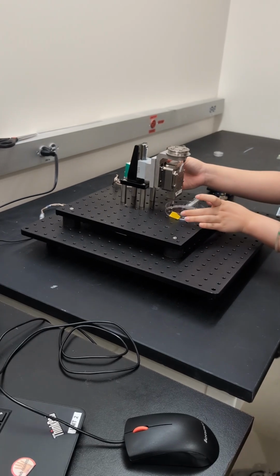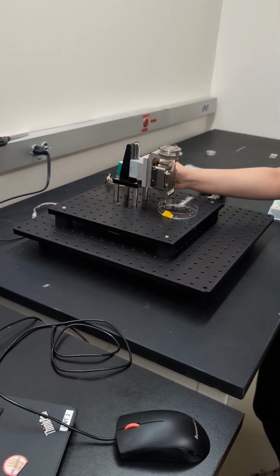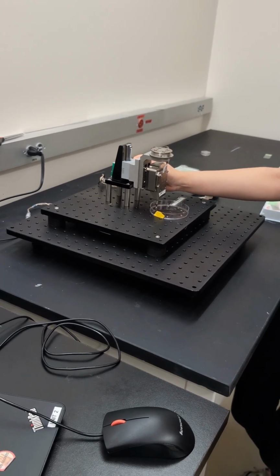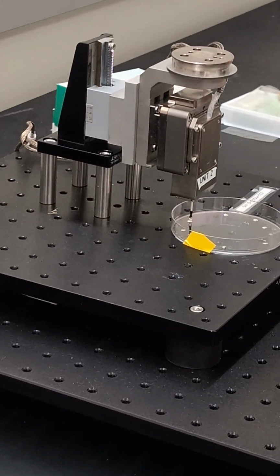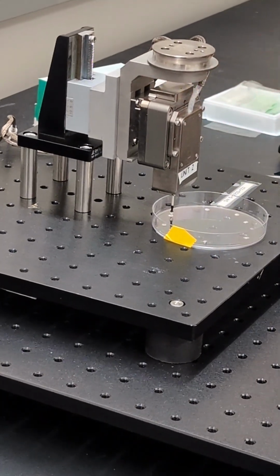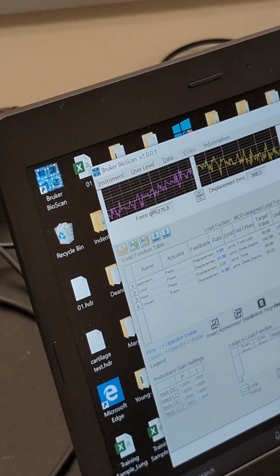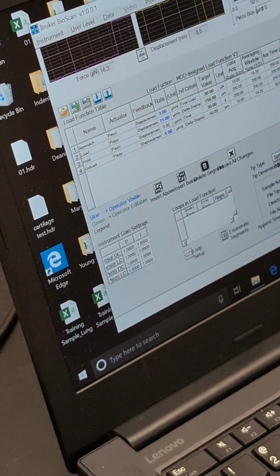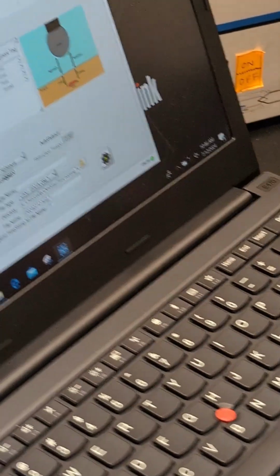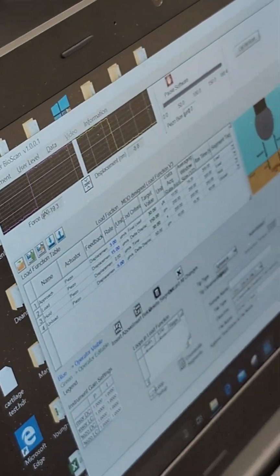But can I move the plate now? Yes. You can go a little bit lower, just right before it gets into contact. I think it's in contact. No, I don't think they are. We will see when we restart the software. If you see a negative force, that means they are in contact. Okay, maybe go a little bit lower. A little lower? Yeah, so this is where you have to monitor the force loading. See if you can keep this force maybe to negative 100.